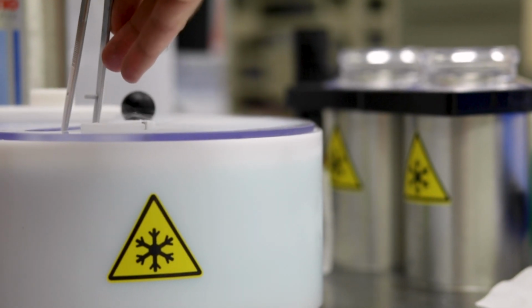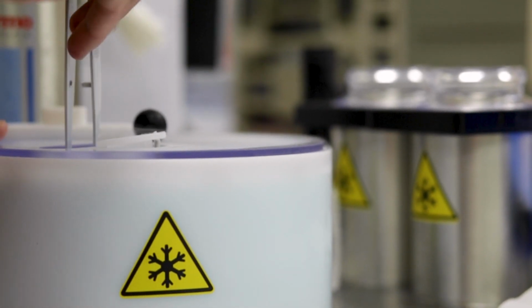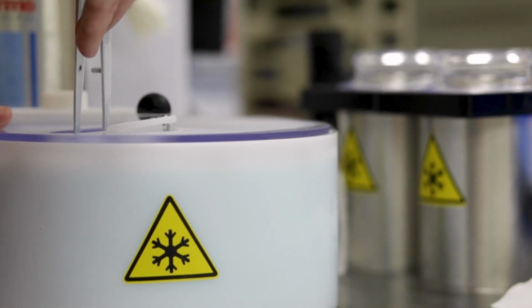We get this snapshot of a CRISPR complex bound to a DNA sequence that really we don't want it to bind to. And what the hope is that we can analyze these sequences, and we're collecting lots and lots of these views that will understand the rules of how it accommodates these variations. And the sort of long-term goal is, can we change the CRISPR complexes in some way that stops binding to these variant sequences and makes the system more specific?